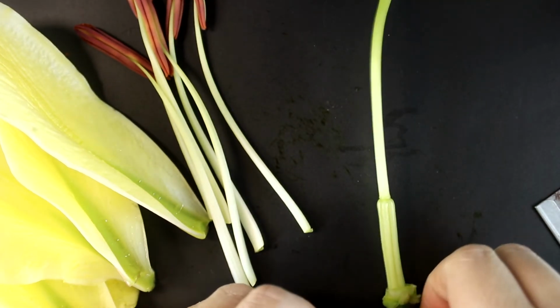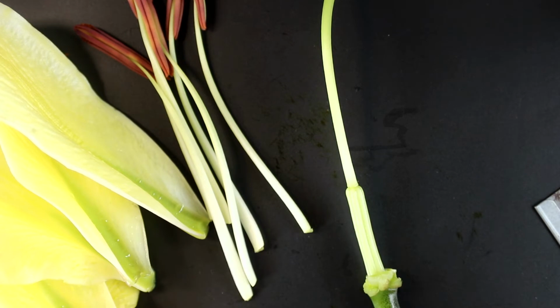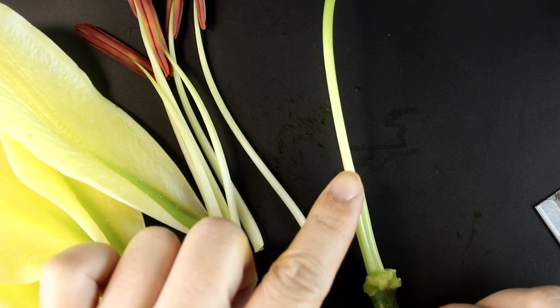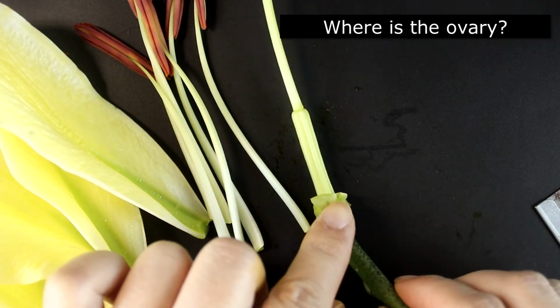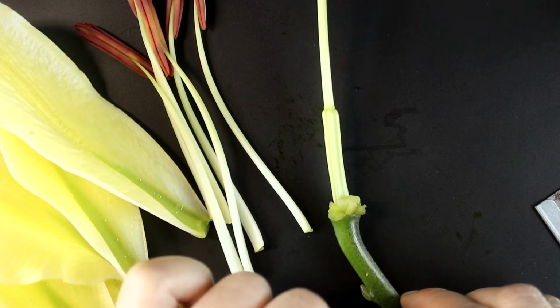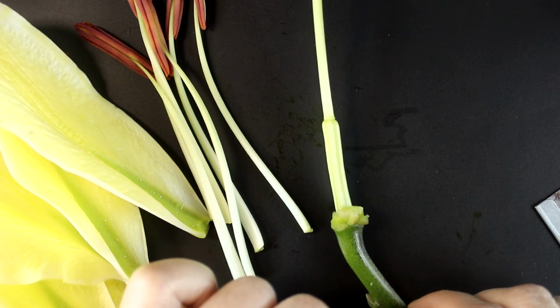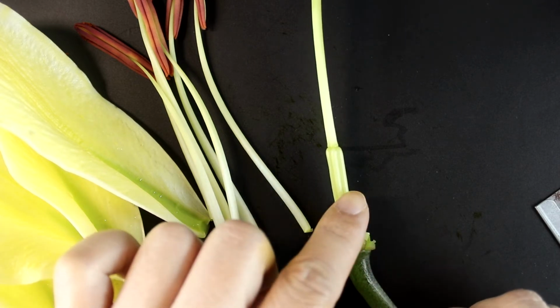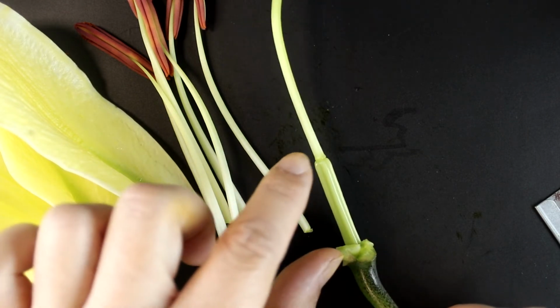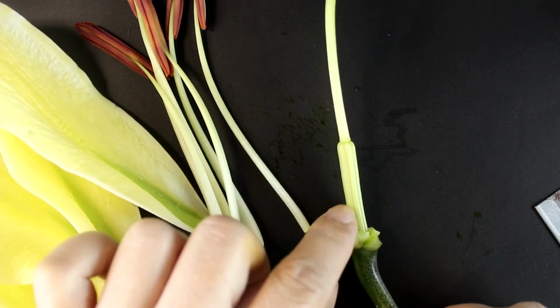So in order to learn more about the carpel number, we need to cut open the ovary. But where is the ovary? It could be here or here. So in order to figure it out, we need to cut it longitudinally. And in order to observe the placentation, we usually cut it transversely. It seems to me it is more likely that here you can find the ovary. Let's try.